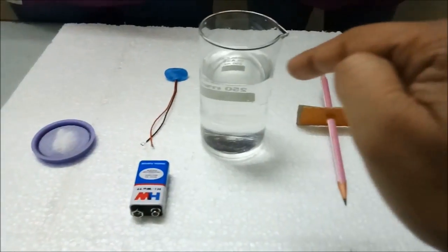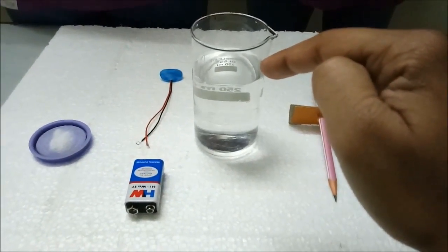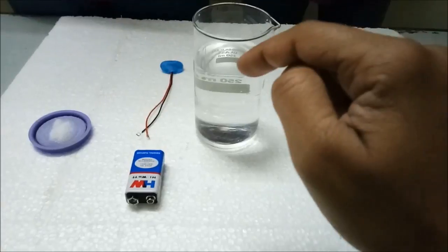We are adding salt into the water as water is a bad conductor of electricity, so we have to make it a good conductor by adding salt in it.